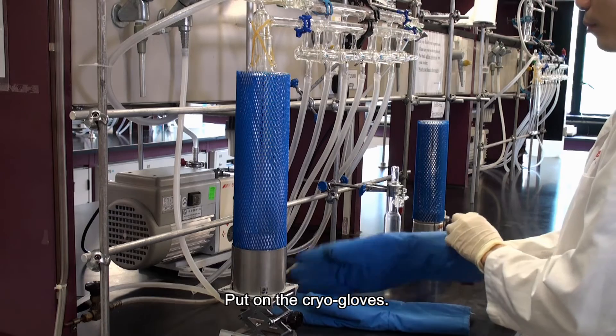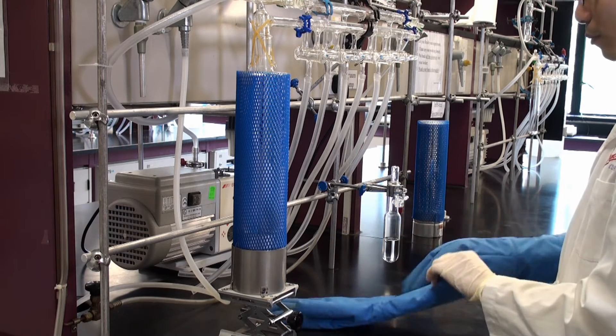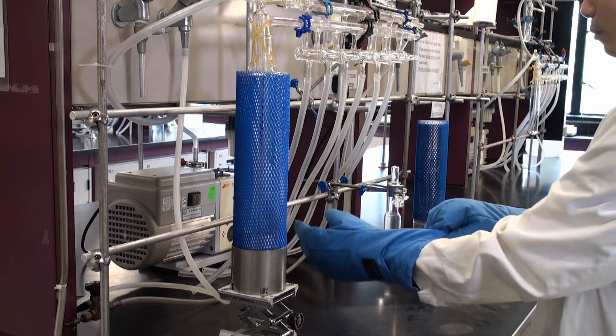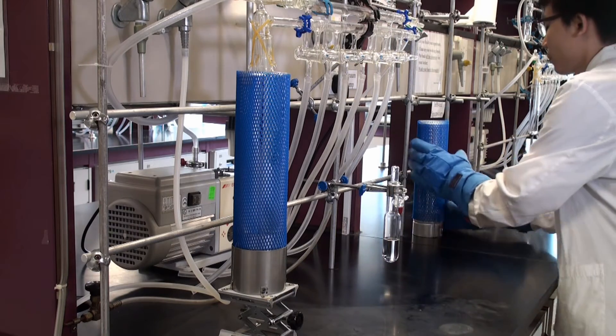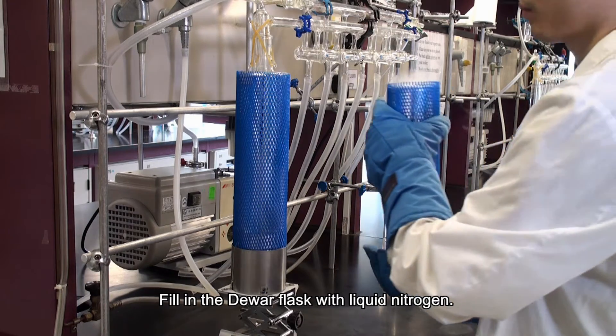Put on the cryo gloves. Fill in the Dewar flask with liquid nitrogen.